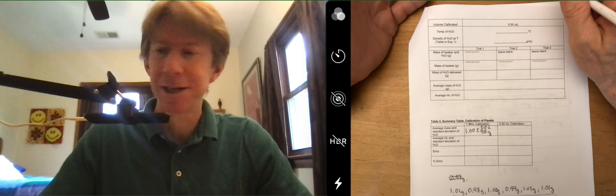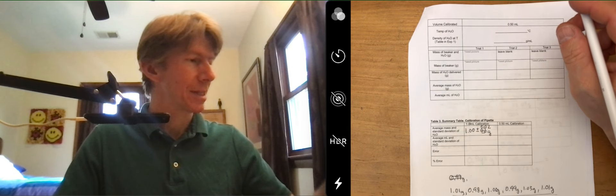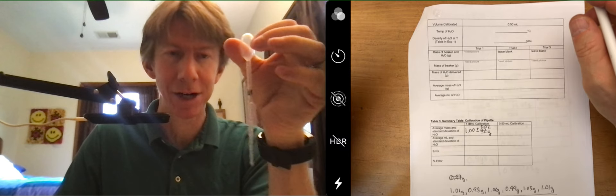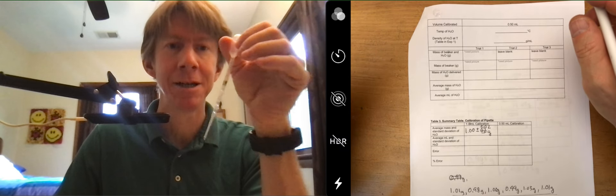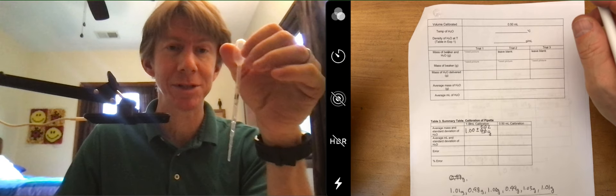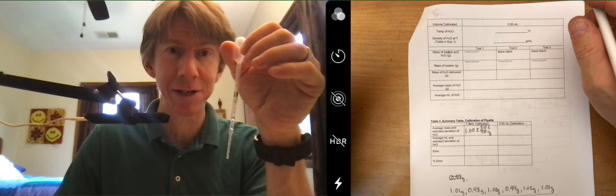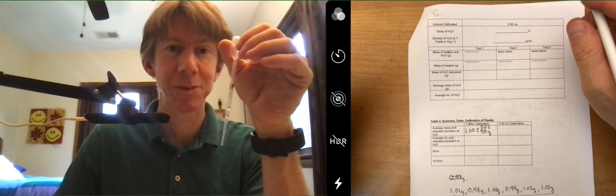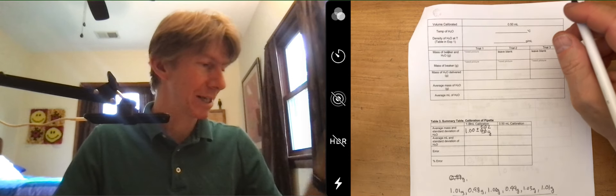And the point of this lab by the way is that these little pipettes, as plasticky as they are, can actually be used very accurately if you draw your own line on it. So that's why we're calibrating this and you're going to need 1.00 milliliters very accurately for future labs so make sure you do this well as I'm sure you are.